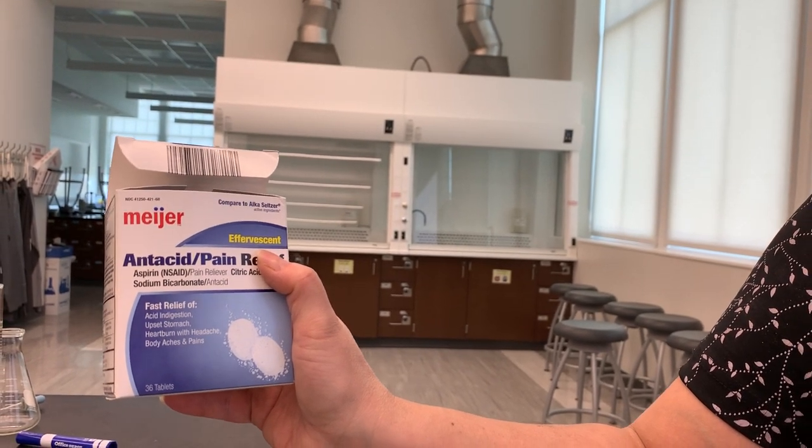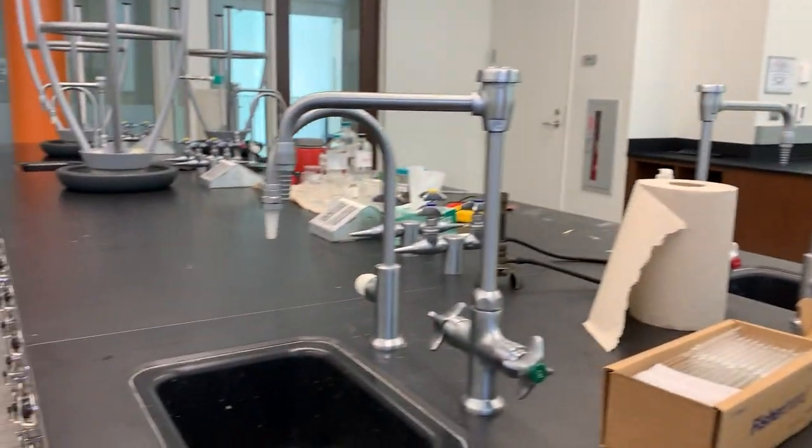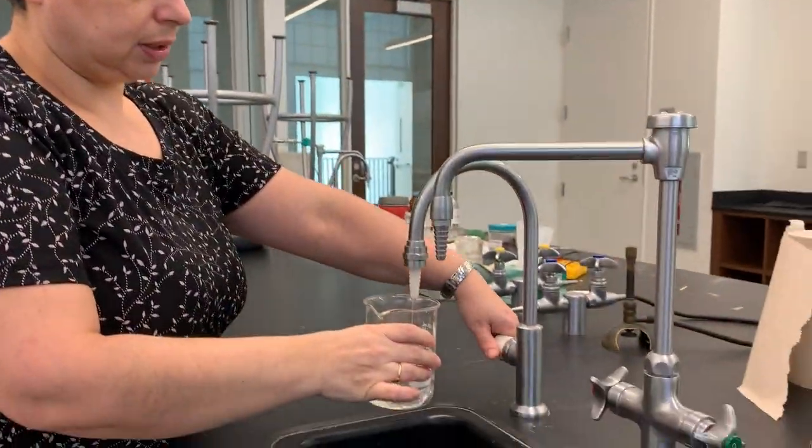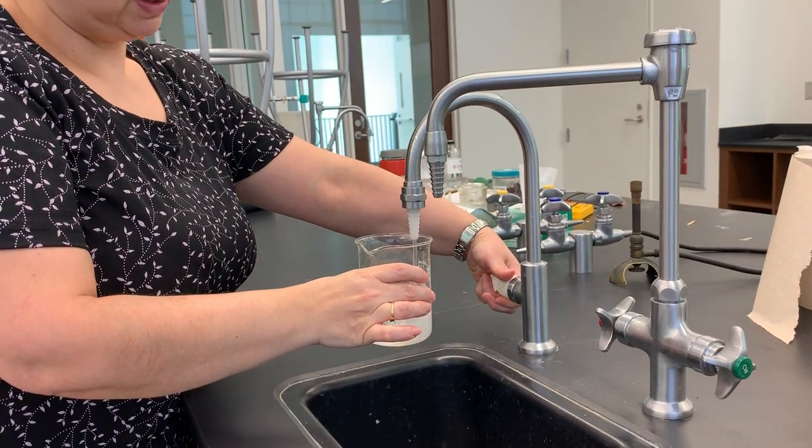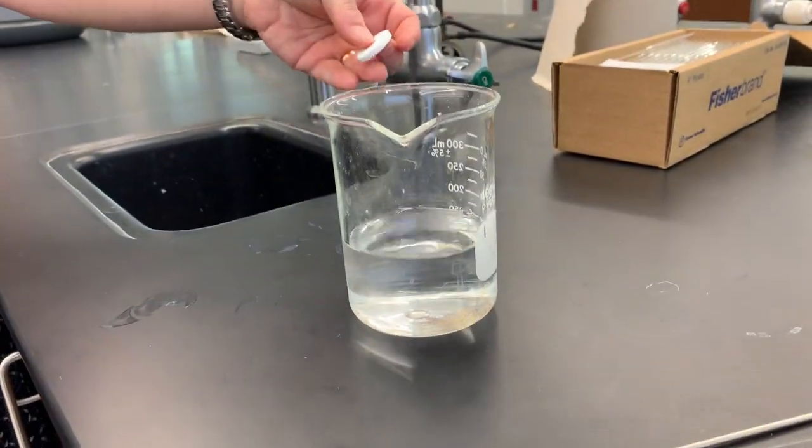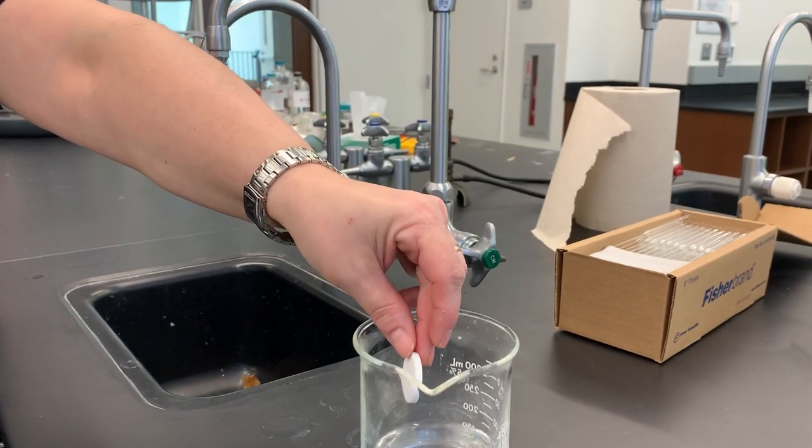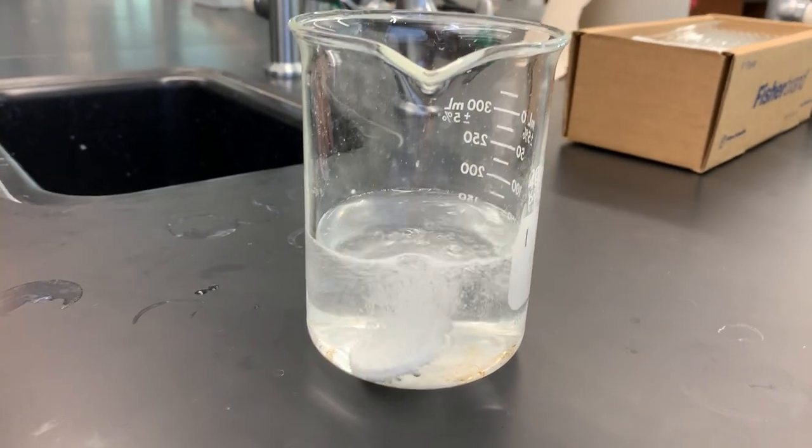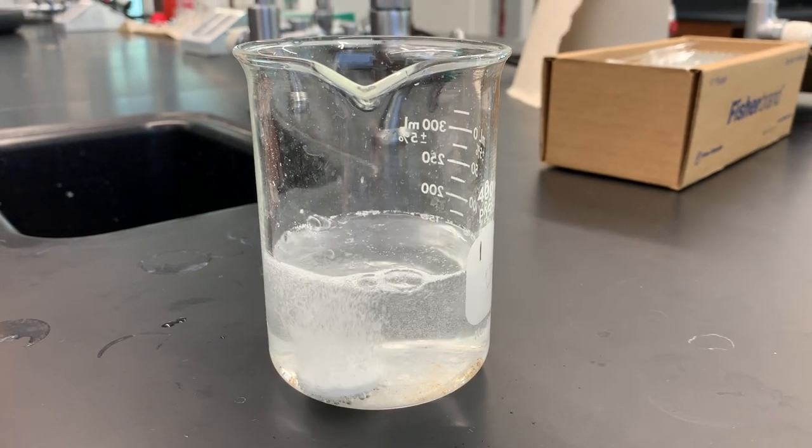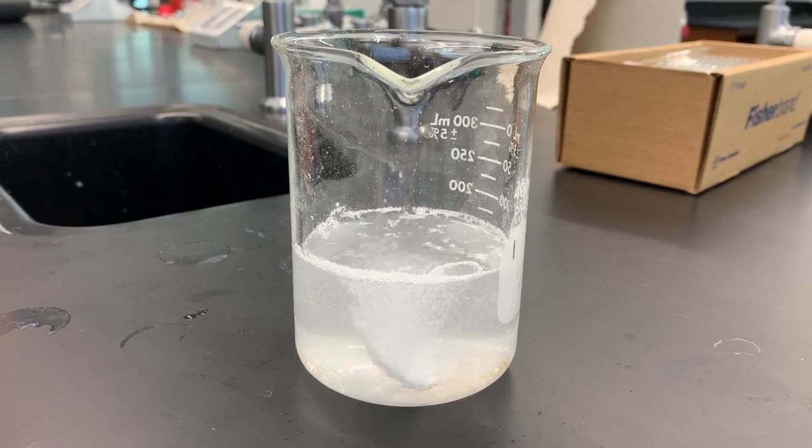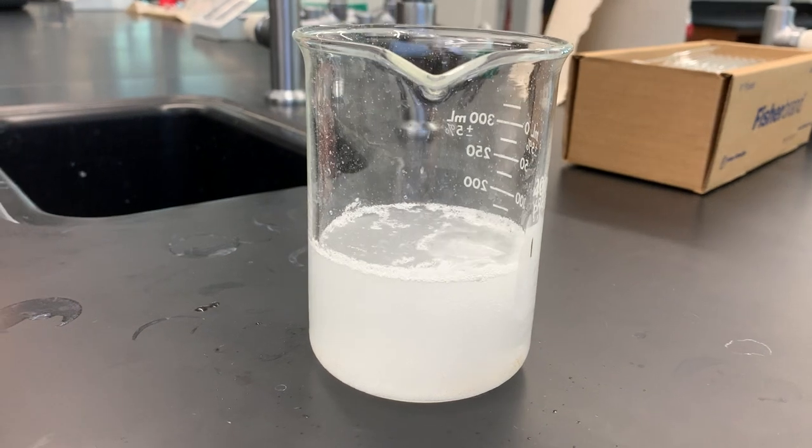So, it kind of is a clue as to what we might see. So, I'm going to take this empty beaker. See, it's empty. So, I don't think I tricked you in any way. I'm going to add some water to the beaker. Maybe a little bit more. And I'm going to drop the tablet, and we're going to watch and discuss what's happening here. Remember, just water. So, what you're seeing is this, in scientific terms, effervescence. In layman terms, it's just bubbles being formed, and the tablet is dissolving and bubbling.